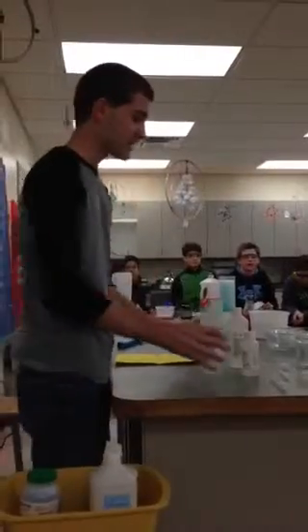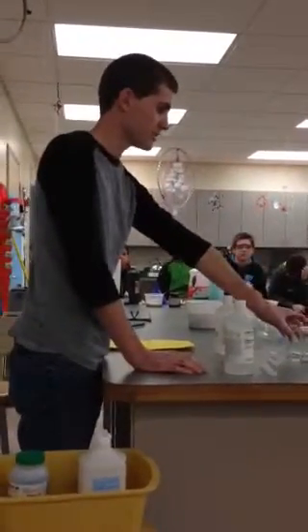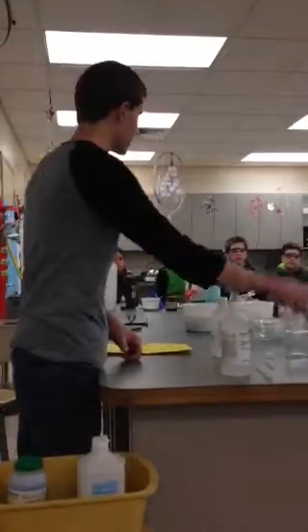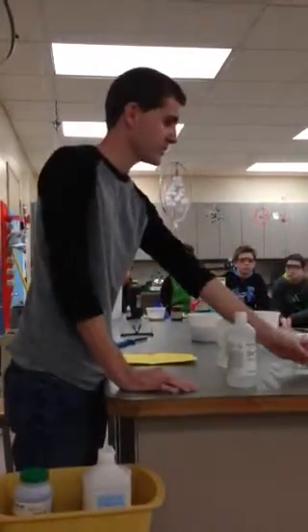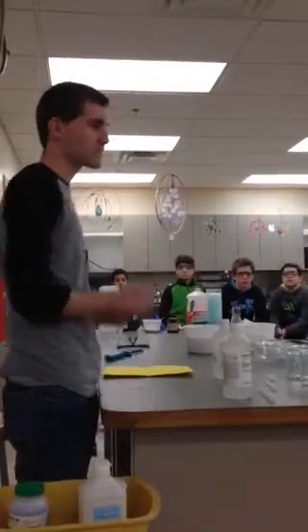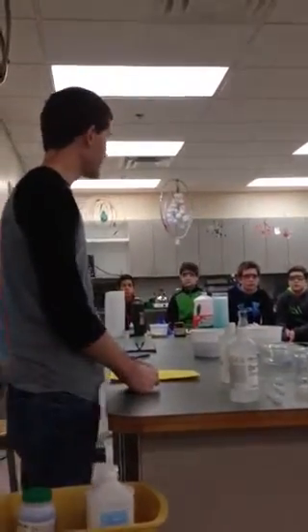Lower pH. So if I go from a high pH and I pour it into an indicator solution, and the indicator solution turns a color that's telling you that it has a base substance in it, and then I take that indicator solution with the pink and I pour it into an acidic solution. So I'm mixing an acid and a base. What's going to happen to the pH? It will neutralize. Yes, and when it's neutralized, it's clear, right? Looks like water.